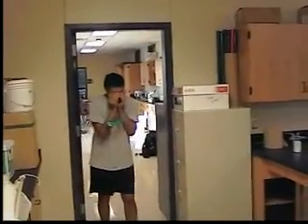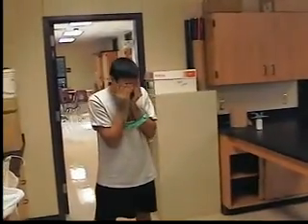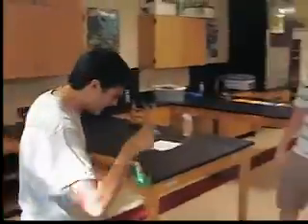Oh my eyes! Is Nick alright? Man, forget about him, look at me! But luckily I found these goggles so that won't happen again. Let's go, Anthony.